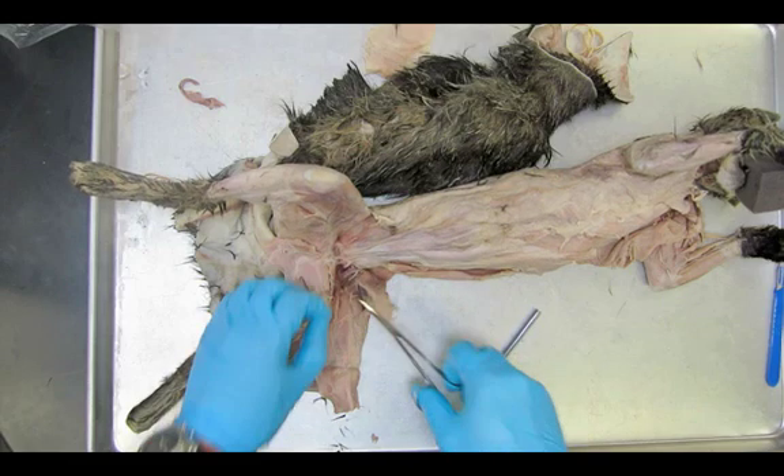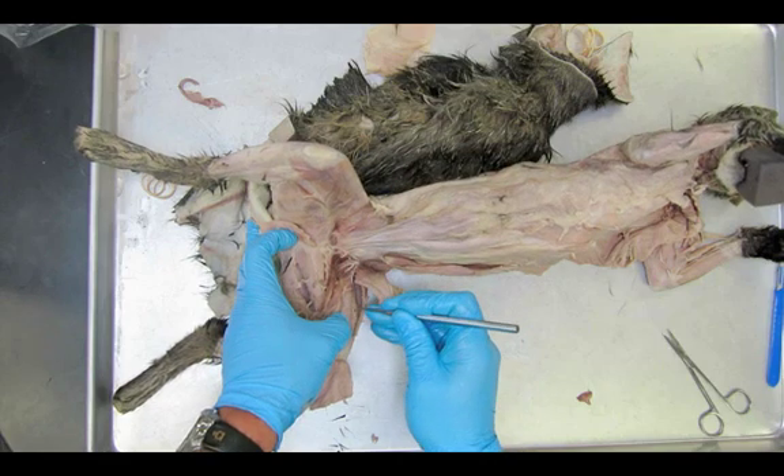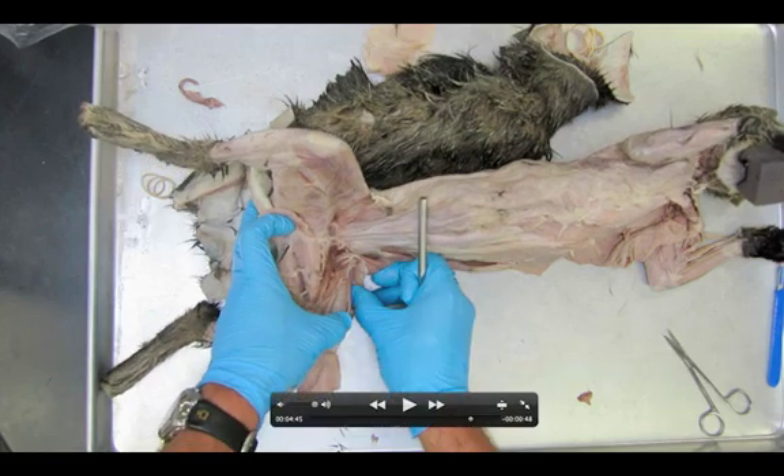There's another little piece of blood vessel to remove. I'm separating what we have — the vastus lateralis. To highlight the muscles: vastus medialis is here on this side, vastus lateralis is here, and in between the two is the rectus femoris. My hands are also grabbing one of my favorite muscles — the tensor fascia latae. The fourth muscle of the quadriceps — since tensor fascia latae is not part of the quadriceps — is the vastus intermedius, and we cannot see it.